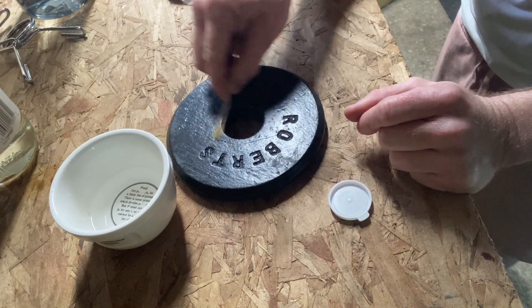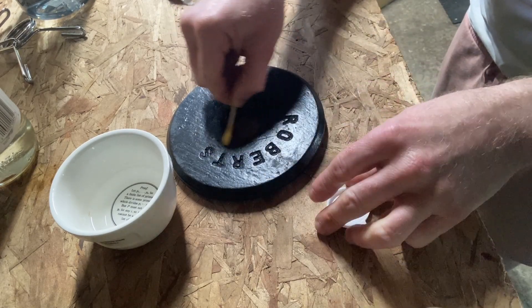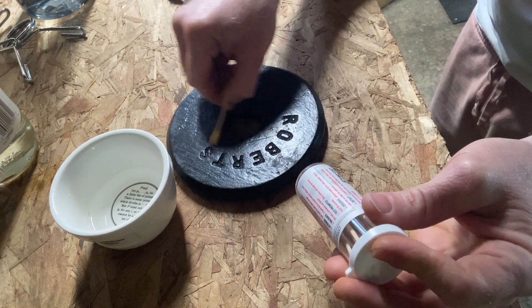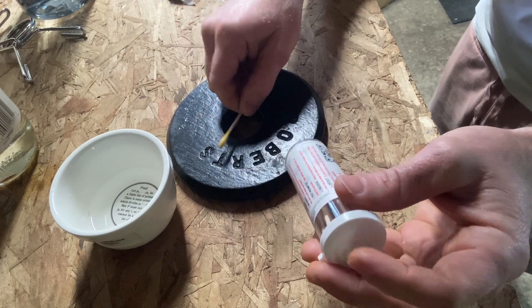I'm not sure if it's been 30 seconds, so I'm gonna wait 20 more seconds. Whoops — I broke the swab, I'm scrubbing so aggressively. It says if the swab turns red, violet, or pink, there is likely lead present. The surface may also stain pink if low levels are present.